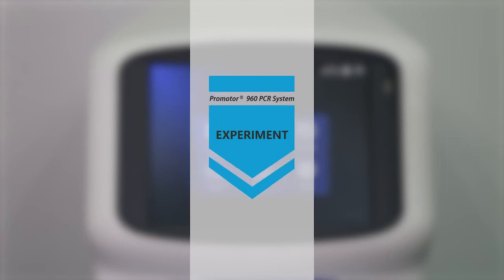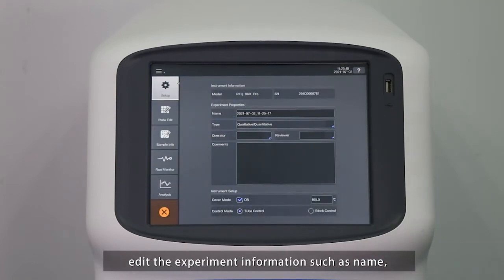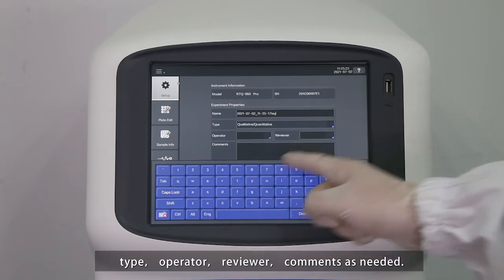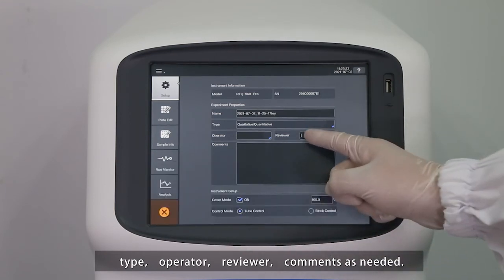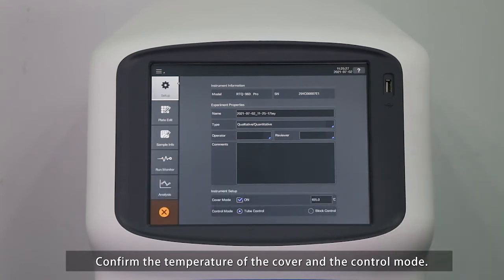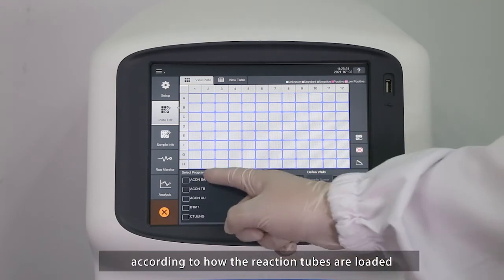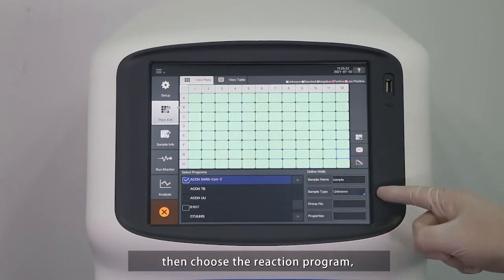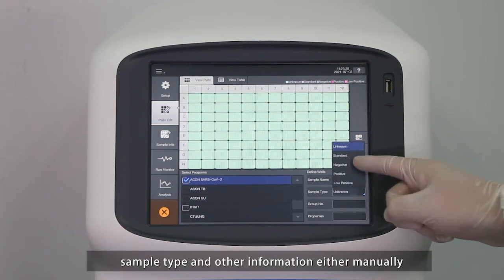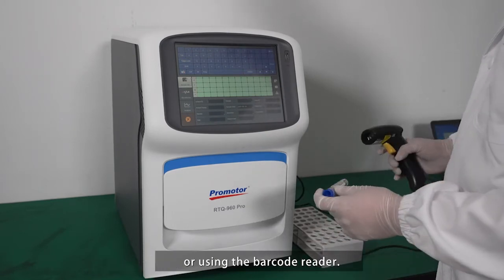Experiment. To create a new patient test or experiment, edit the experiment information such as name, type, operator, reviewer, comments as needed. Confirm the temperature of the cover and the control mode. Select the reaction well positions according to how the reaction tubes are loaded. Then choose the reaction program. Edit the sample name, sample type, and other information either manually or using the barcode reader.